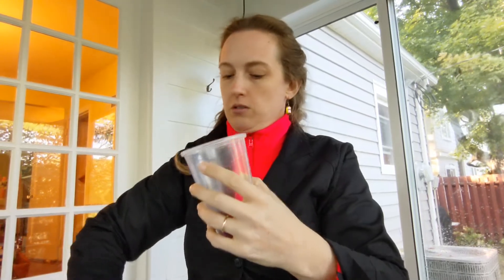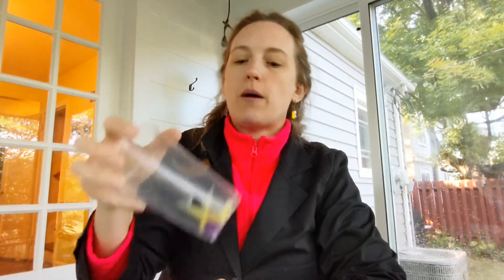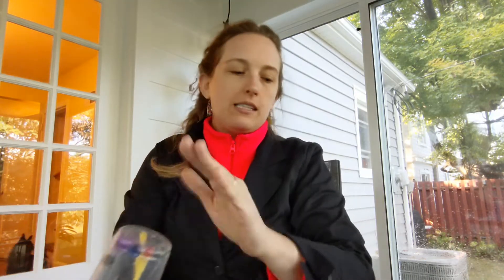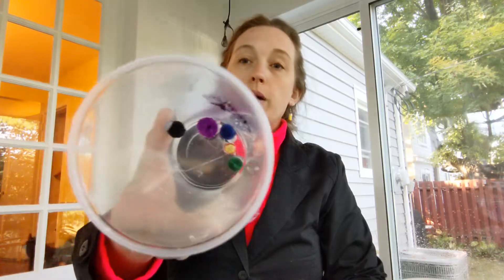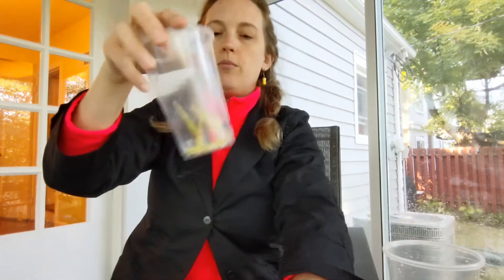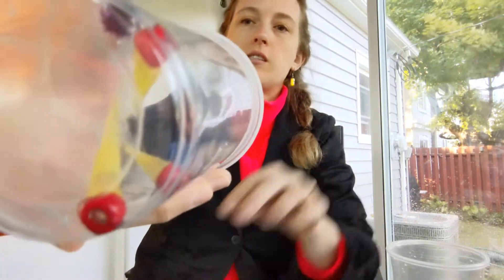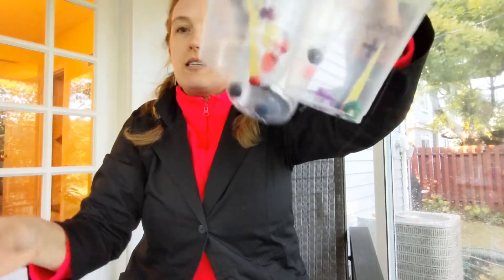Now let's try the second sample — add all the primary antibody and give it a little time to conjugate, which just means stick. The antibody I added is specific to meningococcus; that is the only antigen this antibody recognizes, so it will ignore any other proteins. That's why in the first cup, even though there were lots of proteins, none stuck — because none were meningococcus antigens. But in the second sample, it found one meningococcus antigen and stuck. In the final sample, after rinsing with buffer, those antibodies found some antigens too — but to the naked eye we still can't tell any difference, so we have more steps to do.